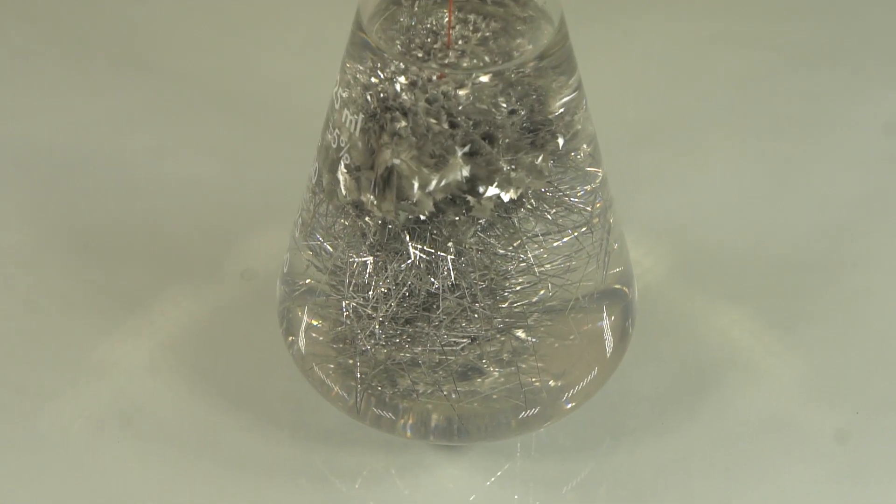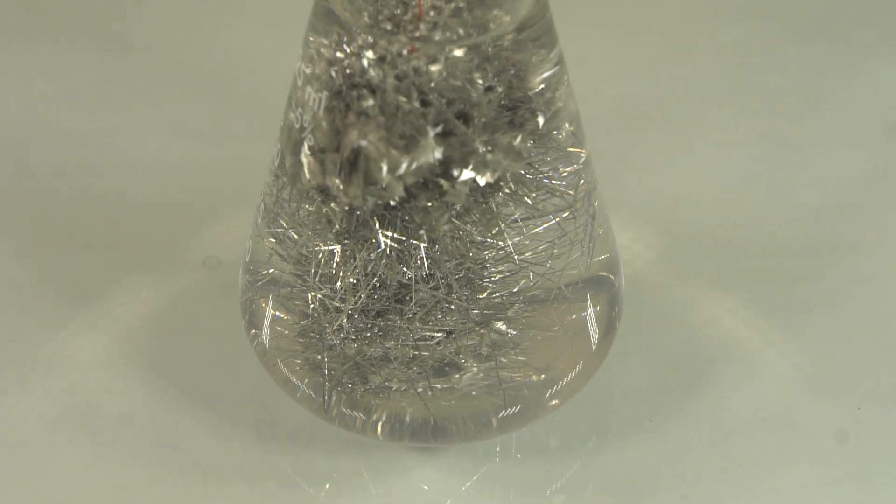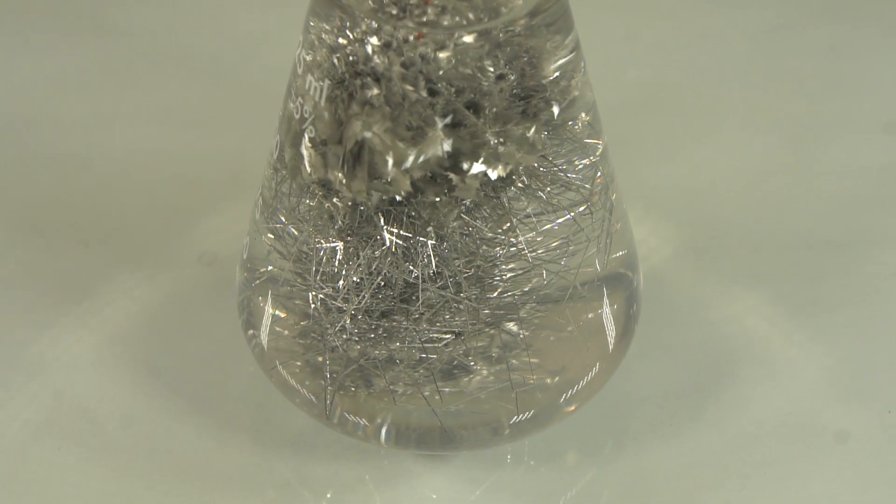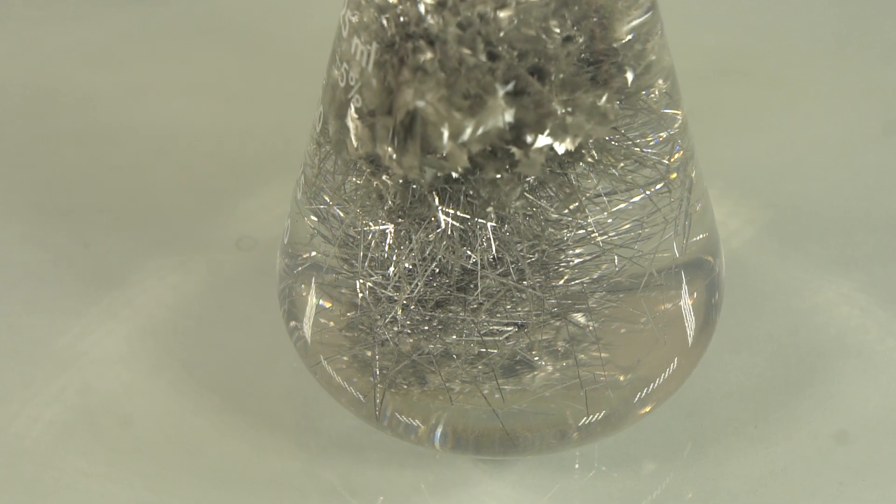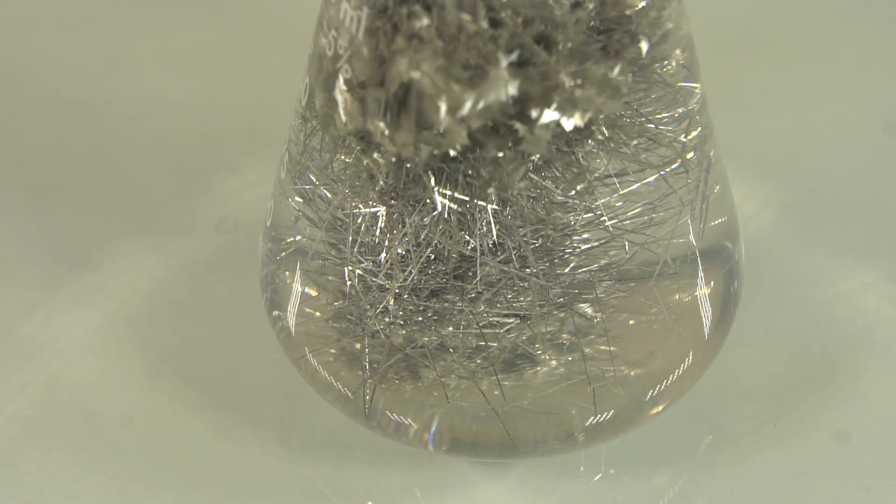I have only seen this experiment mentioned a couple times online, using a weaker solution. I use a more concentrated solution of tin chloride, which I think helped produce more dramatic crystals.